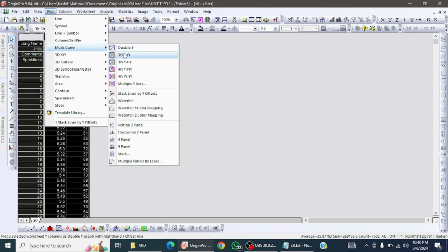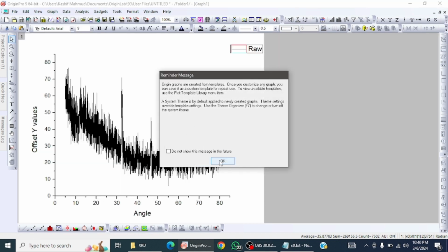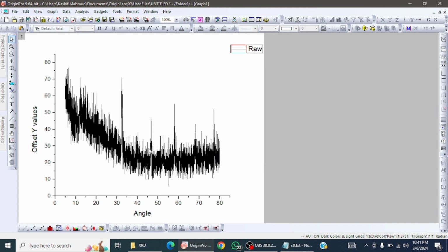Go to Multicurve, Stack Line by Y Offset. So you see that in this graph there is a lot of noise and the peak cannot easily be recognized to analyze. So now I am going to show you how to remove this noise.